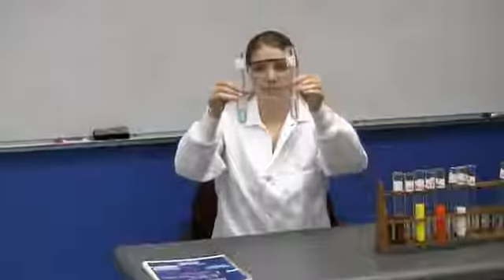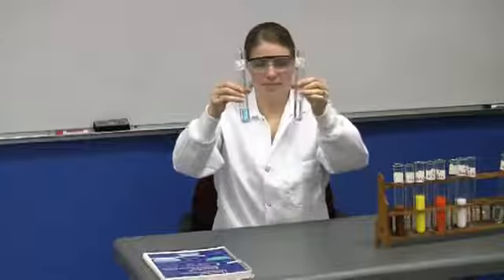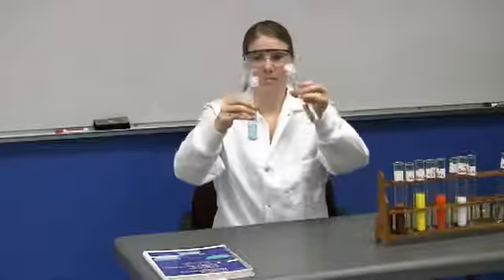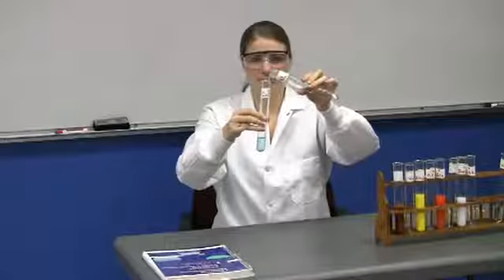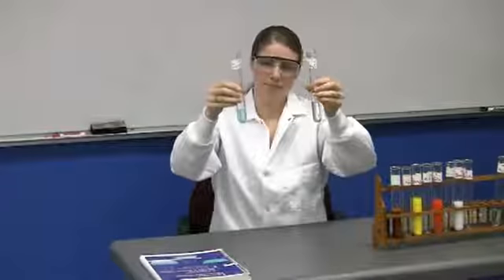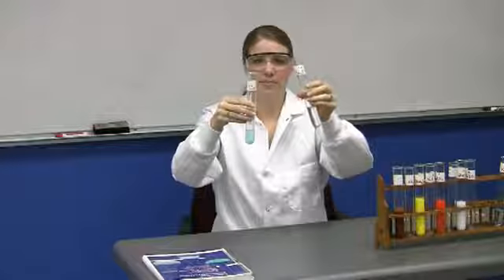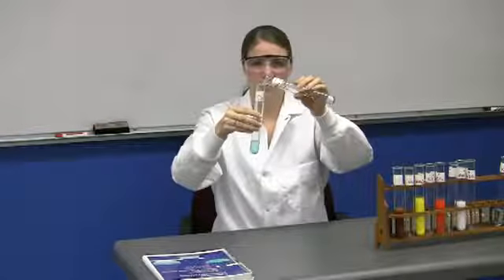The next pair of compounds is CuCl2 and Na2CO3. Na2CO3 was also in the first batch of test tubes, so it reappears. Notice that this is the first and only test tube that has a blue color. So you will know, if you don't already know, why that test tube is blue.